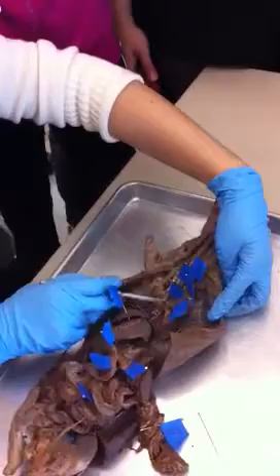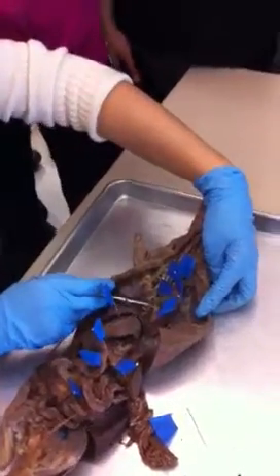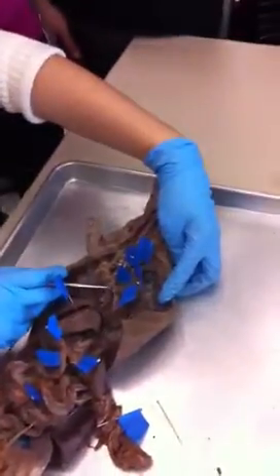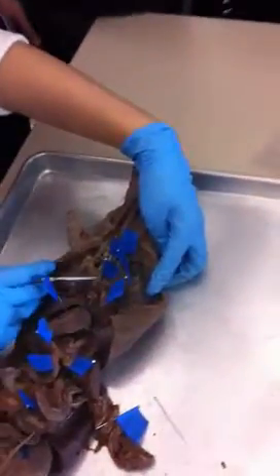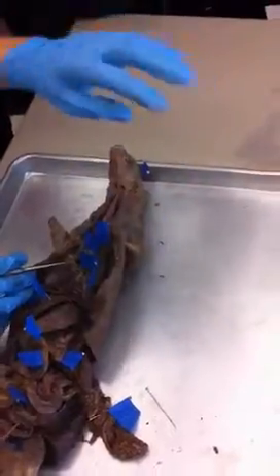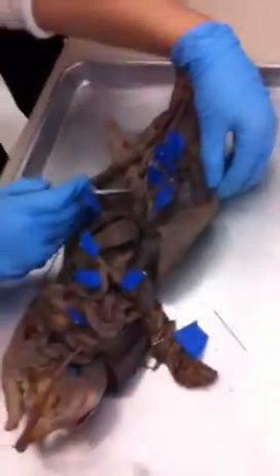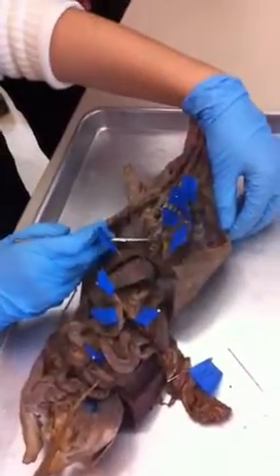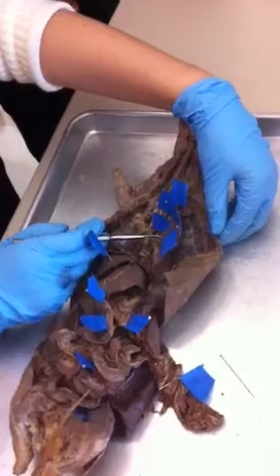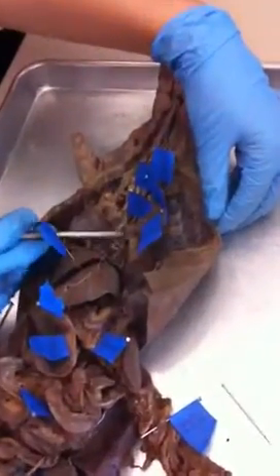Split into the left and the right bronchi, and then into the secondary bronchi, into each lobe of the lung. So you have some idea of what you need to look at. It's trachea, split into the primary, split into the secondary, into each lobe of the lung.